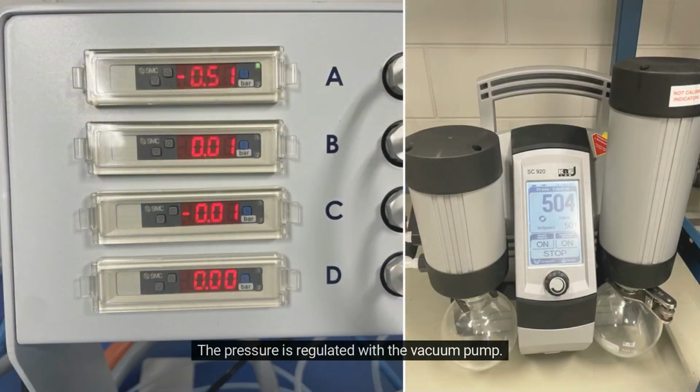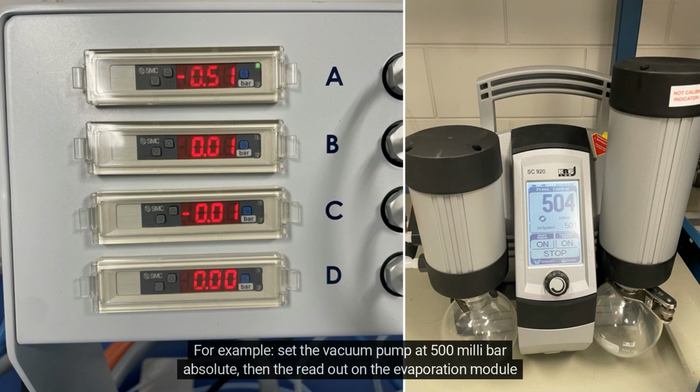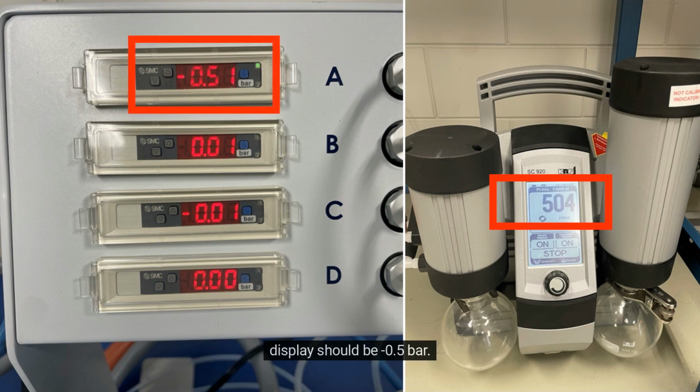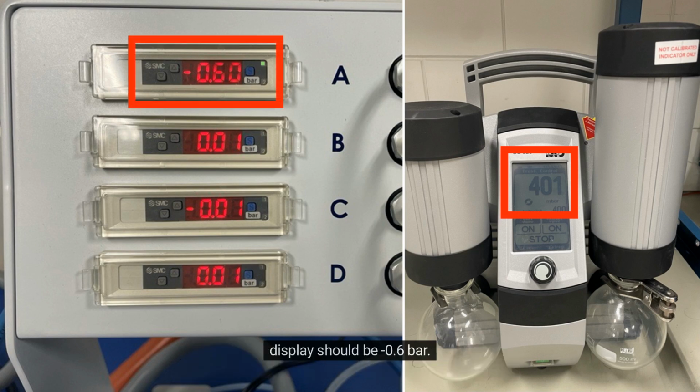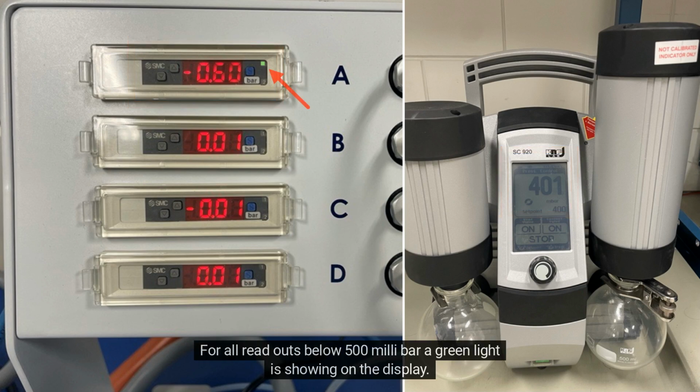The pressure is regulated with the vacuum pump. For example, set the vacuum pump at 500 millibar absolute, then the readout on the evaporation module display should be -0.5 bar. Equally, when the vacuum pump is set at 400 millibar absolute, the readout on the evaporation module display should be -0.6 bar. For all readouts below 500 millibar, a green light is showing on the display. This is an extra indicator that there is vacuum in the circuit.